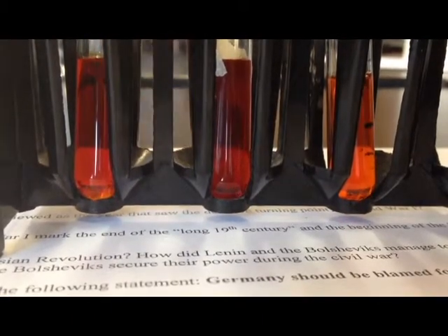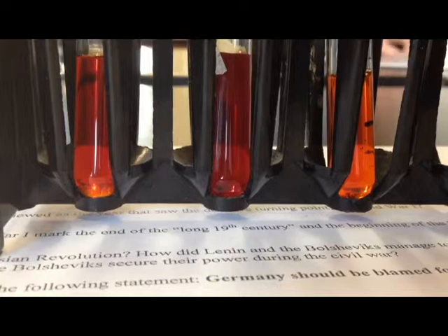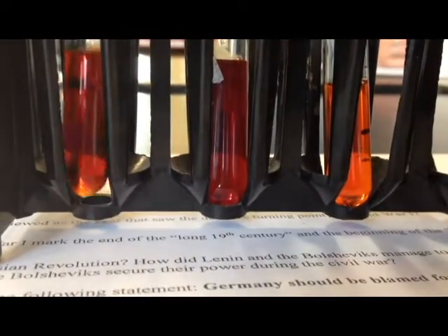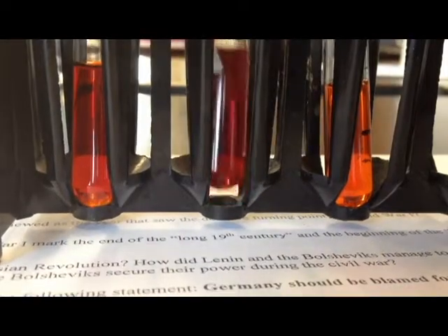To the second test tube, we added 20 drops of 0.1 molar potassium thiocyanate. This also resulted in a color change from red-orange to deep red.